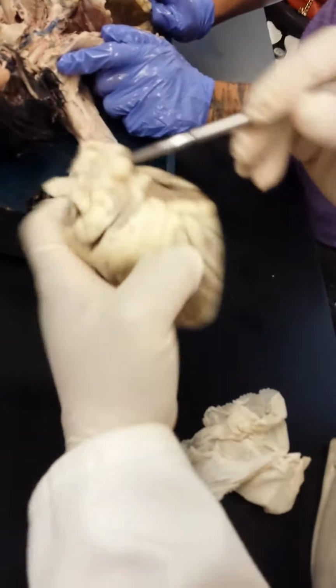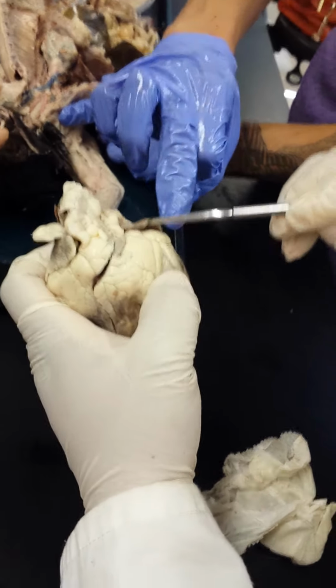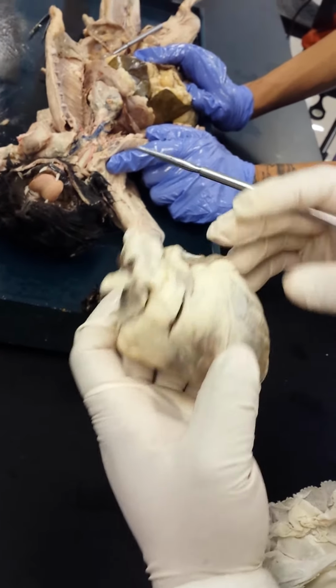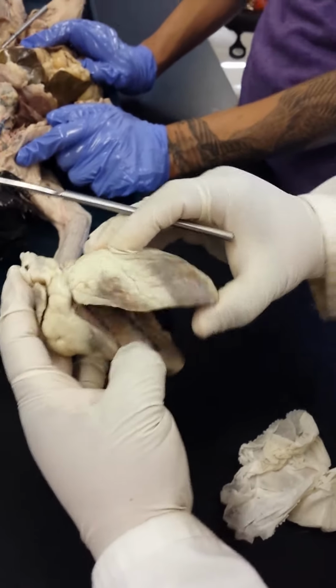You said these are auricles? These are the little auricles, right? That's the left auricle. Left auricle, right auricle, pulmonary trunk. So it's those floppy stuff. They almost look like little dog ears, right? Auricles. So now we're going to open it up.